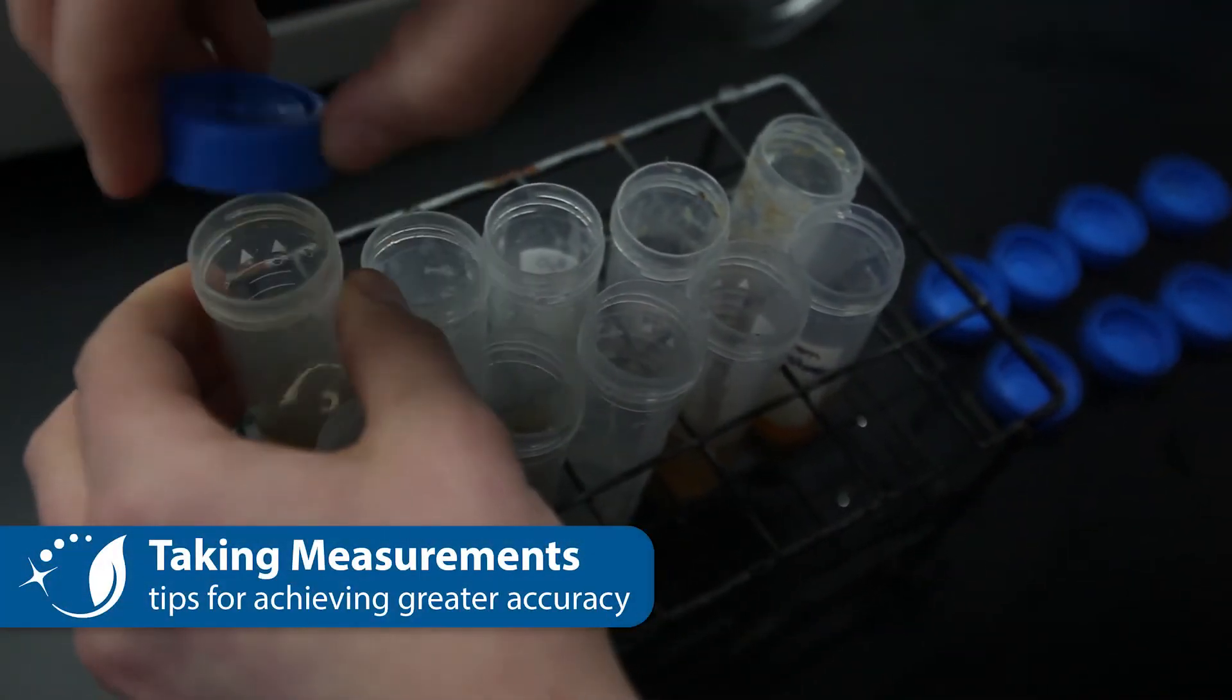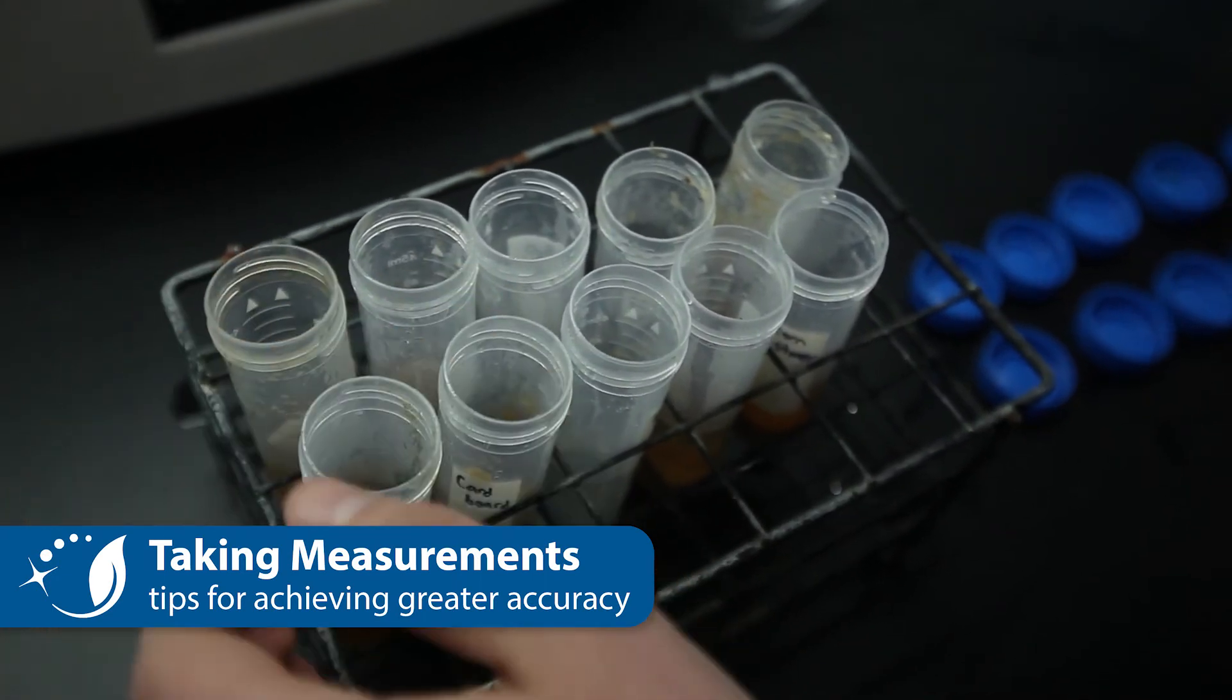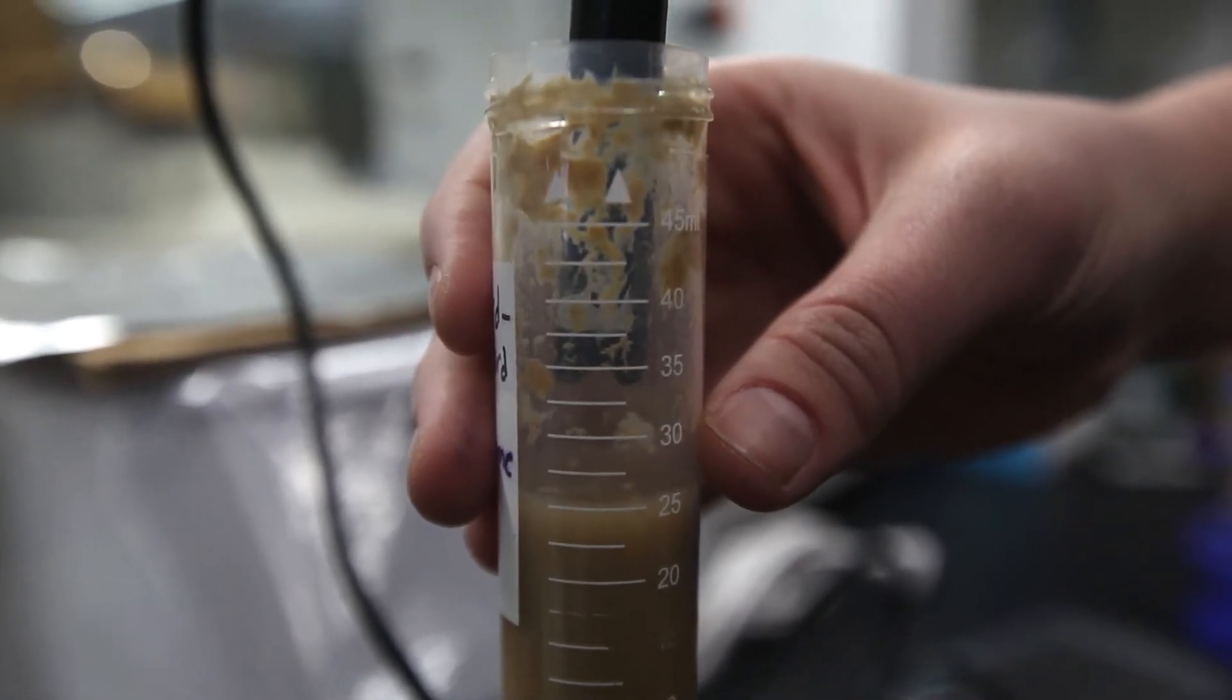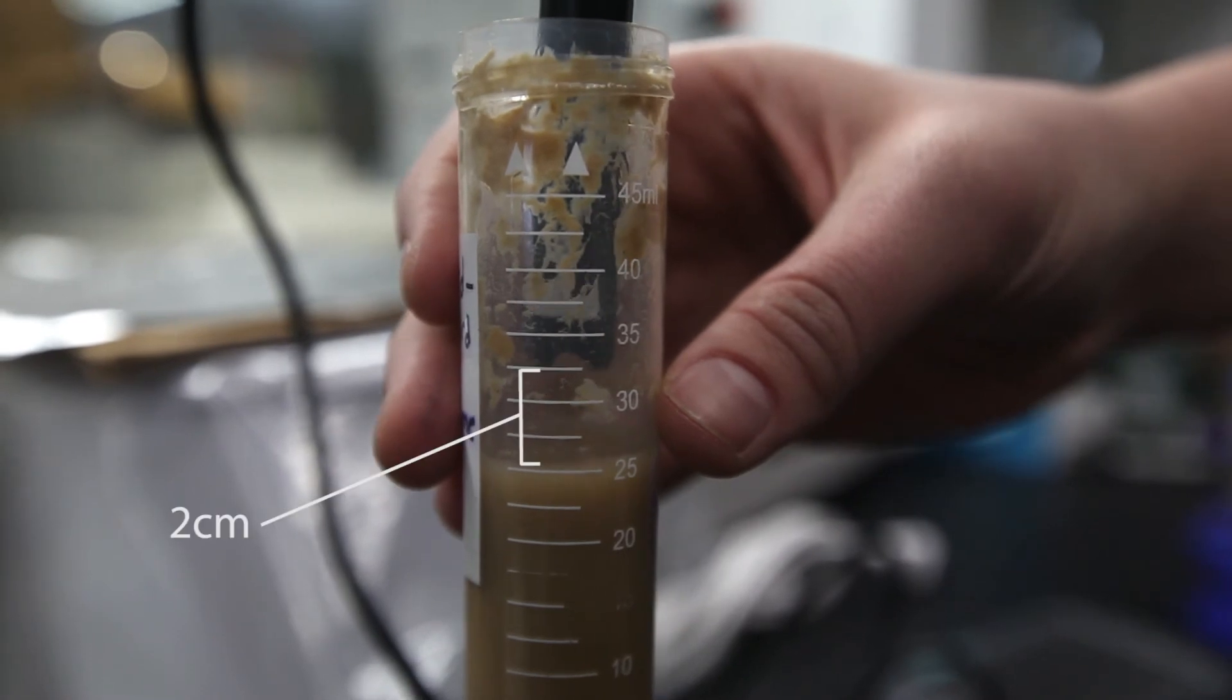Open the containers and allow them to rest for approximately 30 seconds. Hold the probe approximately two centimeters over the liquid. The height of the probe affects the reading, so try to be consistent across measurements.